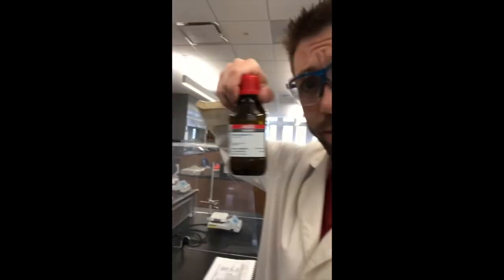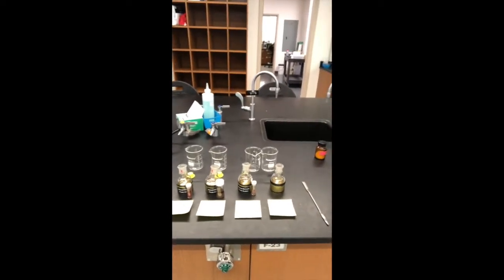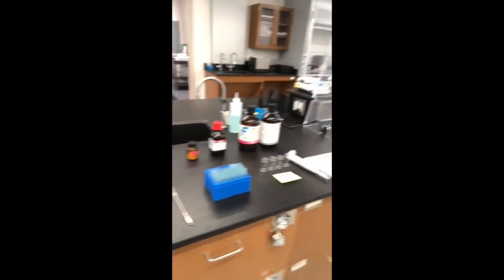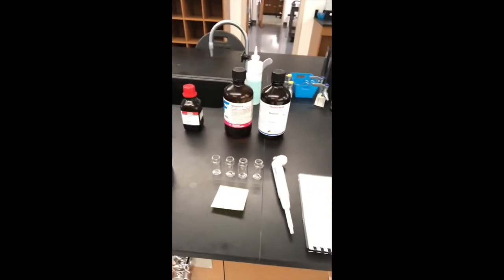So we fortunately have a bottle of styrene oxide right there, and we're going to use that and open it up with methanol. And so methanol will be the nucleophile that comes in and opens the epoxide, and we're going to evaluate your 3 different catalysts to do that. So here on the table, I've got your 3 different catalysts, 3 different reaction vessels set up, a control. I'm just going to set up one since I'm doing all this myself, and there's no need for 3 identical ones. And pretty much got everything I need.